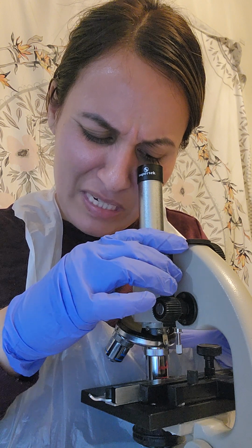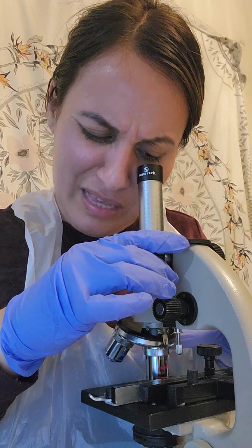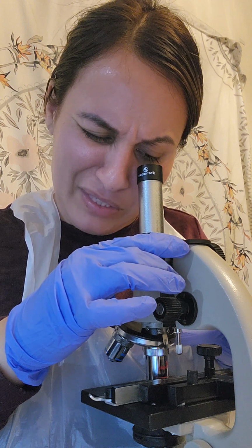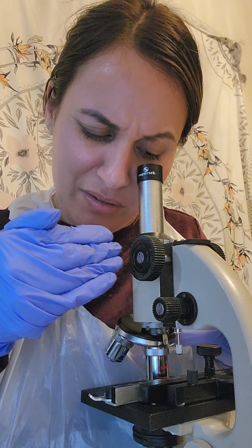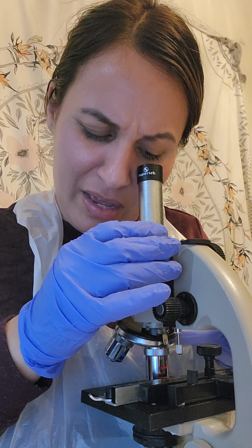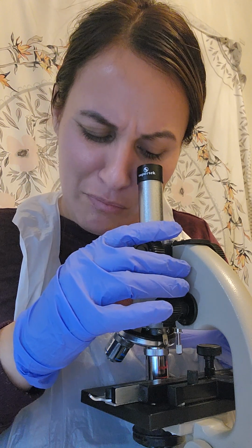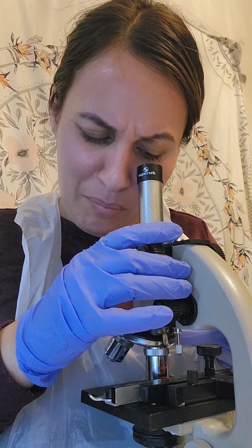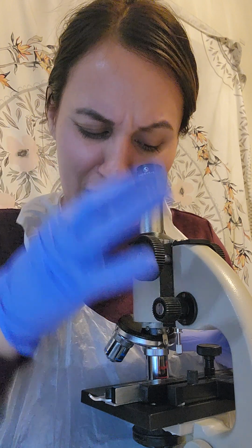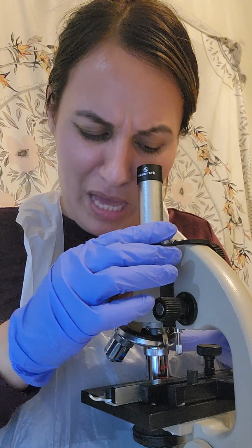You can't even really tell on this that it is anything. It just looks like a big black stripe kind of through the lens, and it looks like it's not as pixelated. It's a little bit more smooth around the edge, the part of the E that I can see. It looks like a big blotch of black. So that's for that one. And that's for the 40x magnification.